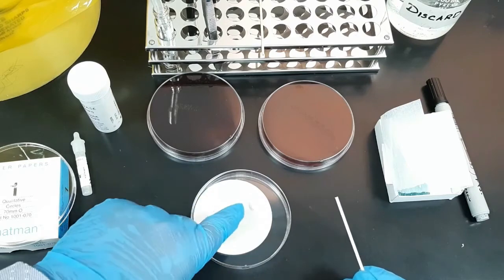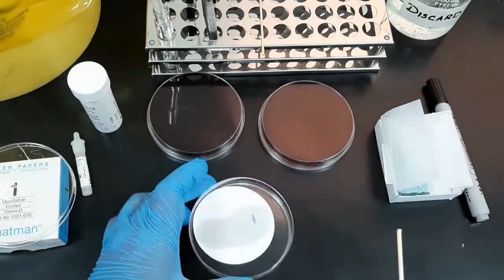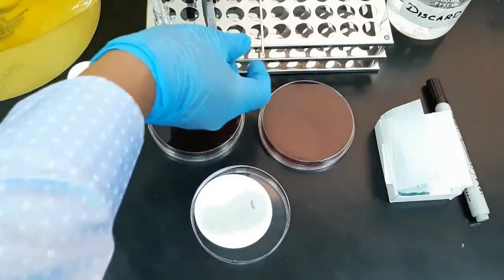A positive reaction is indicated by the formation of purple color. Discard the stick immediately into the discarding jar.